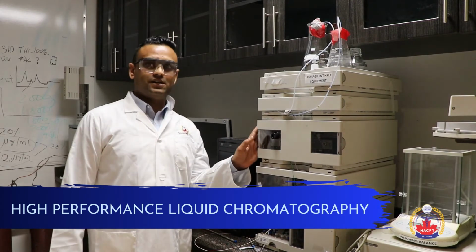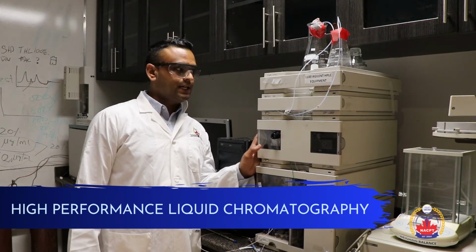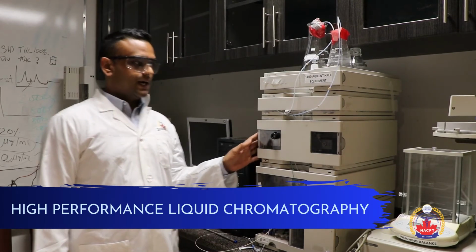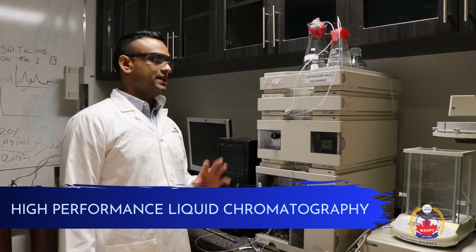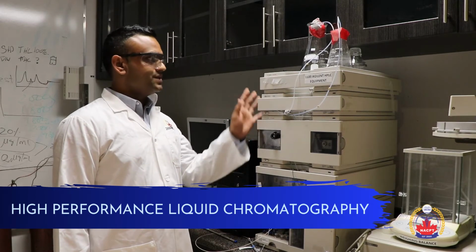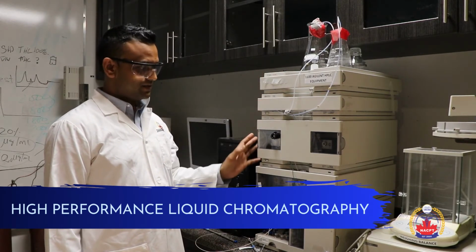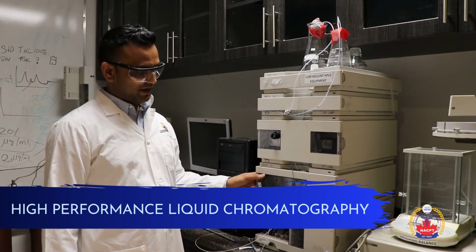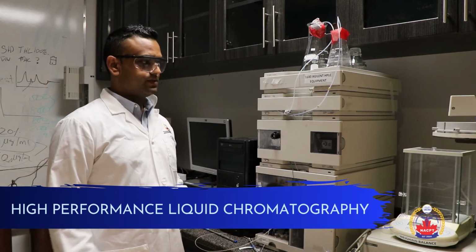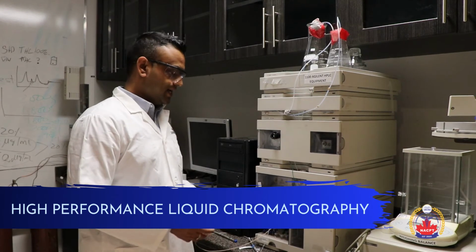This instrument is one of the most popular instruments used in the pharmaceutical industry. It's called HPLC, High Performance Liquid Chromatography. During the lab training, I go through each component of this instrument, starting with the pump, the degasser pump, then the detector as well as the sampler, and the column compartment. I explain all the components, not only practically but theoretically.